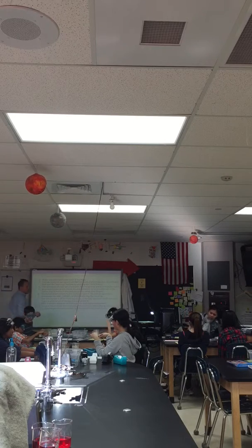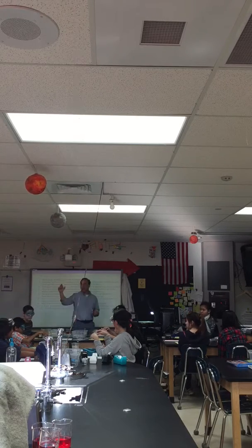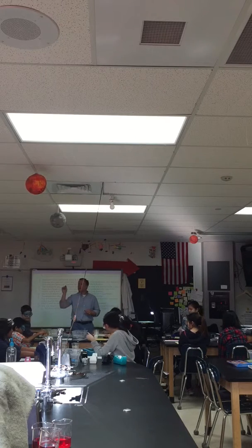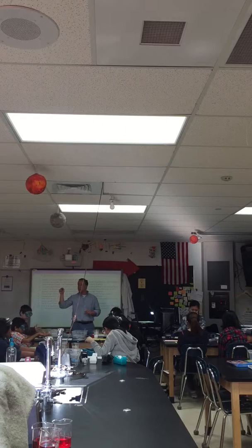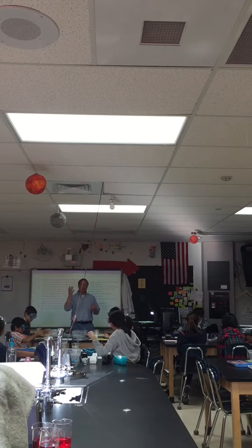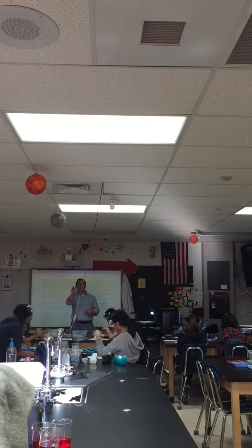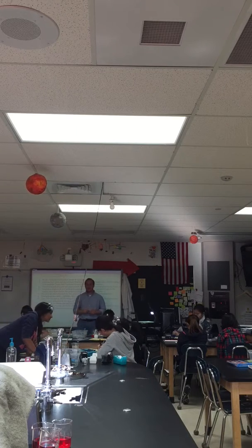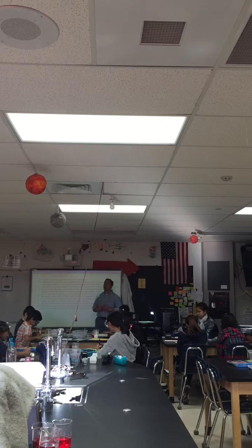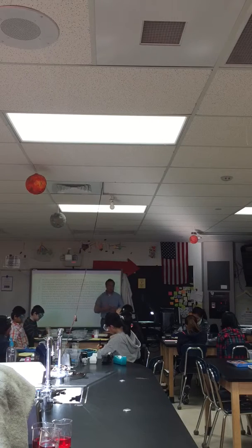Put this on first. Everyone pay attention. Yes, you put the cup onto the scale. It'll measure out 4 point something, I think. Hit the tare button to zero it out. Yeah, we're at 1.5. I did the petri dish. I didn't do these. So make sure it's zeroed out. Ben, Ollie, are you with me back there? You know how to zero out back there? Yeah. Cool. Just making sure.